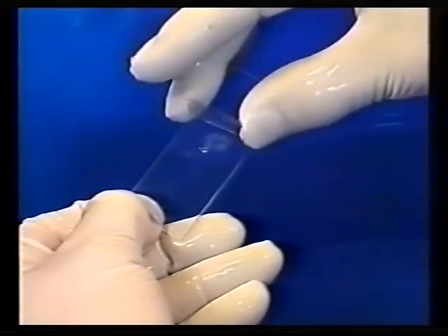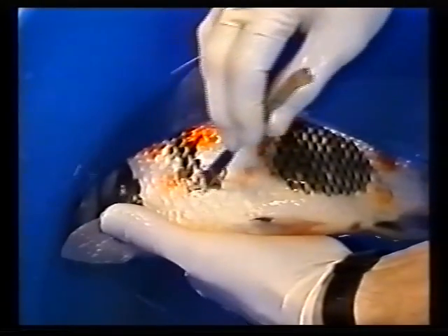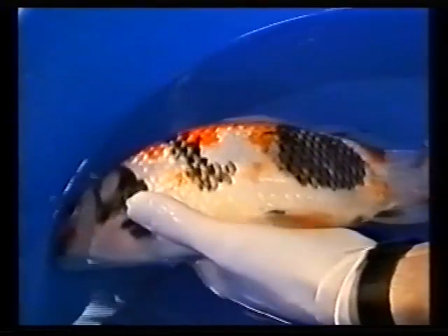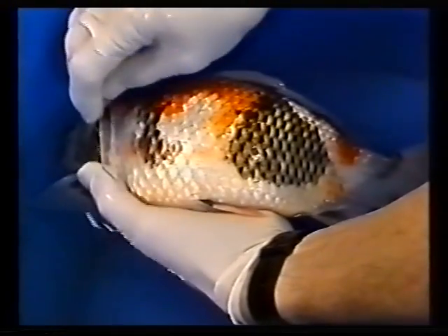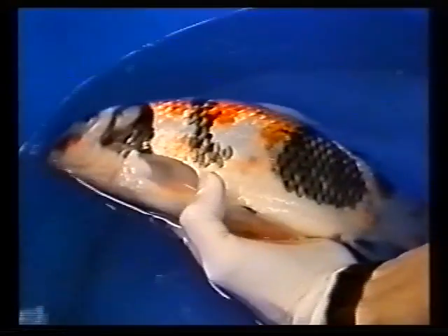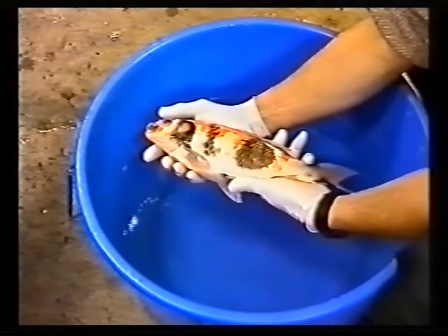You will need a slide and cover slip. You will also need an instrument to take the scrape, although most people use the slide itself. If you decide to use the latter, care must be taken, or damage to the fish's skin or scales could be the result. Fish are susceptible to muscle spasms when the scrape is being taken.